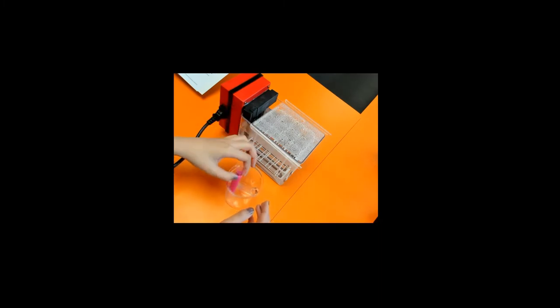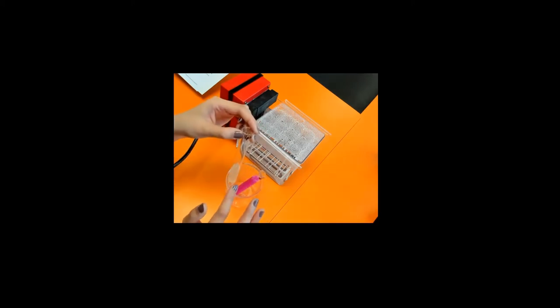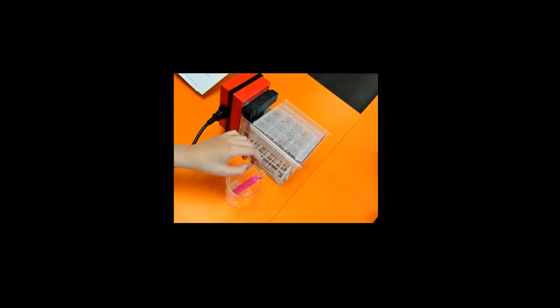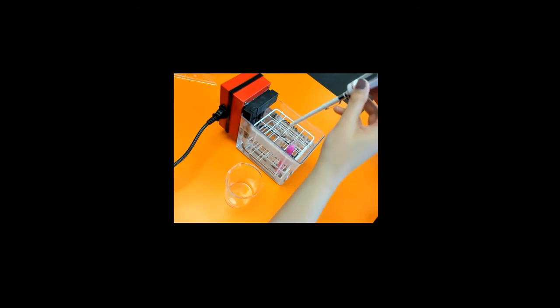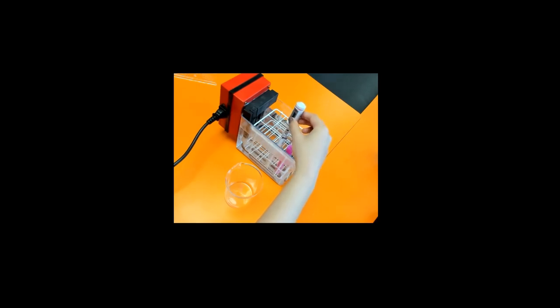I also added five centimeter cubed of lipase solution into this. I've got this water bath set at 40 degrees Celsius. I've placed both test tubes into the water bath and I'm just going to place this digital thermometer into the test tube and just wait until it reaches 40 degrees Celsius before I start the next step of the practical.